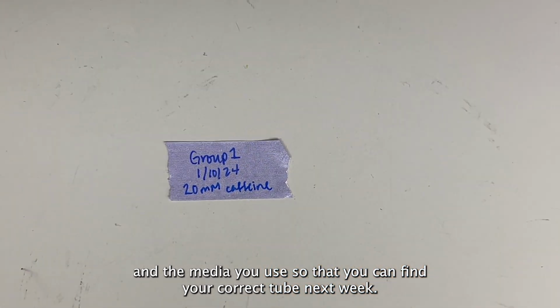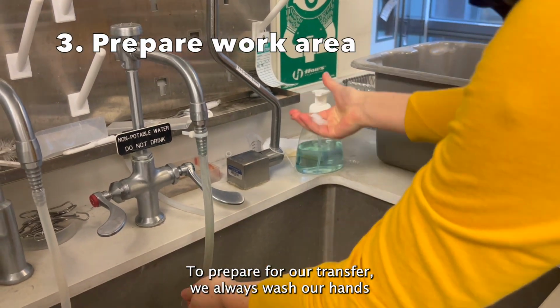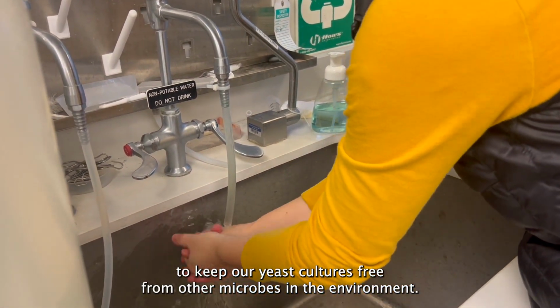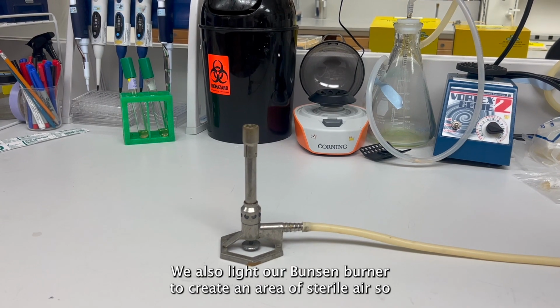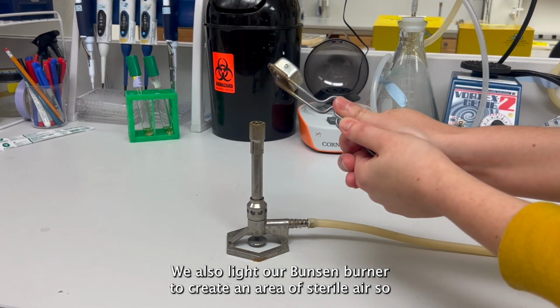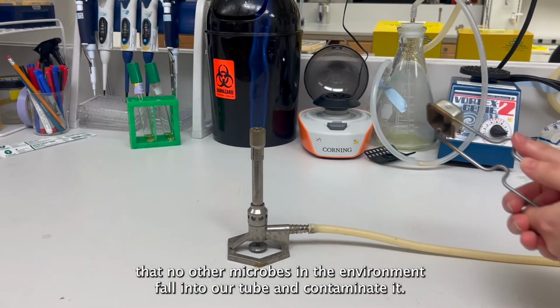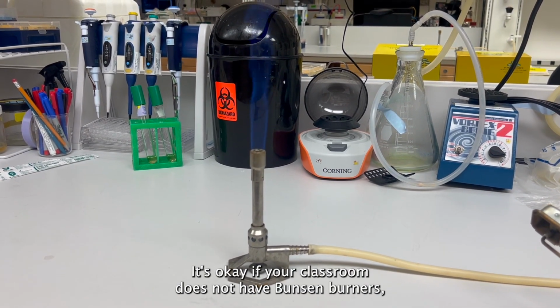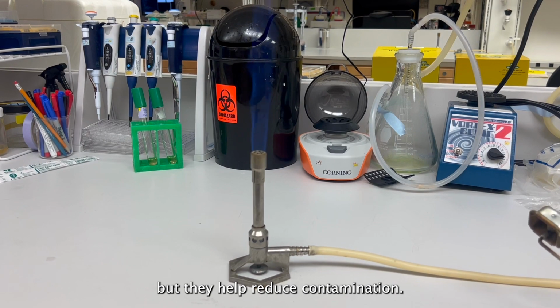To prepare for our transfer, we always wash our hands to keep our yeast cultures free from other microbes in the environment. We also light our Bunsen burner to create an area of sterile air so that no other microbes in the environment fall into our tube and contaminate it. It is okay if your classroom does not have Bunsen burners, but they help reduce contamination.